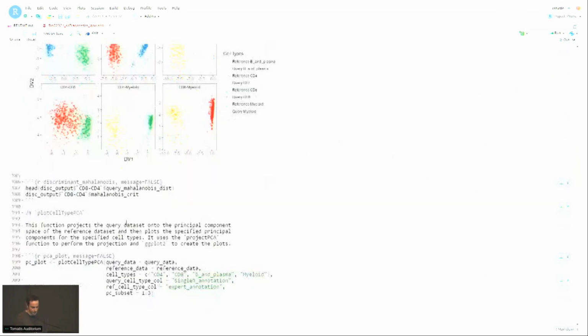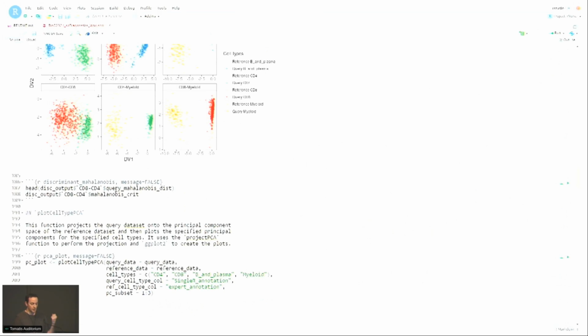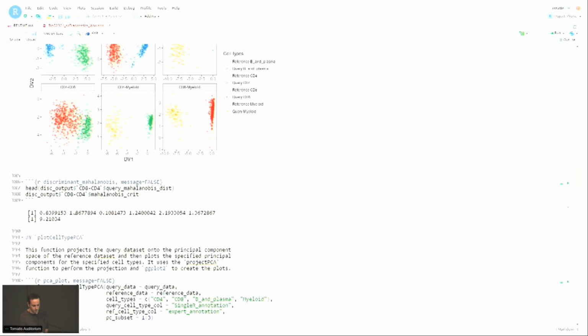Just as an example here, what we can get is the Mahalanobis distance from the query to the reference data, and then the critical value based on the sample size as well. So just to give an example, this is one of the outputs you can get. So the critical value, for example, is 9.21. And then if any value falls above that value, it means that it falls pretty far off based on the Mahalanobis distance from the reference data.